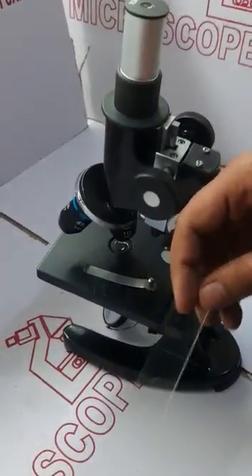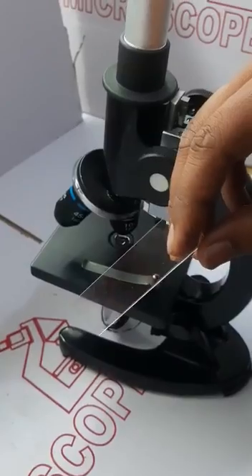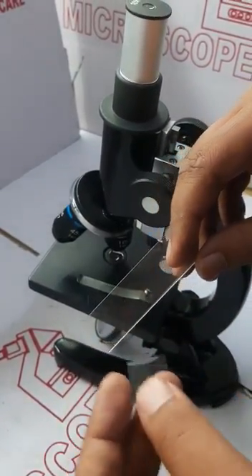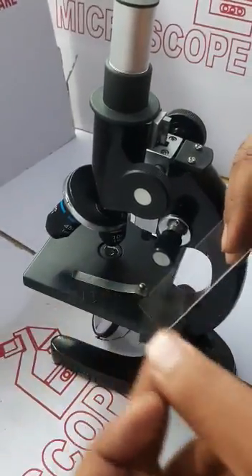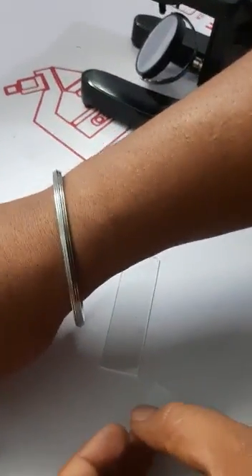I'm going to tell you how to create a sample. For creating a sample, you just need a plain slide and a cover slip, and just start creating a sample.